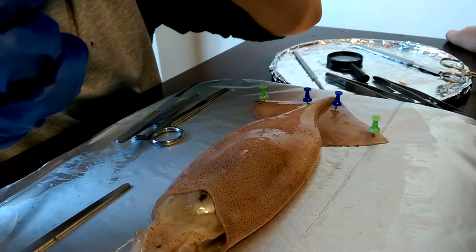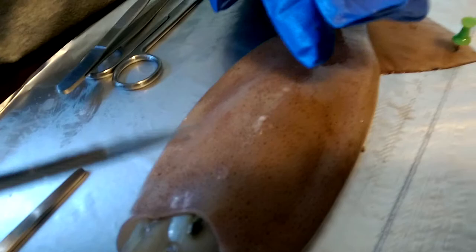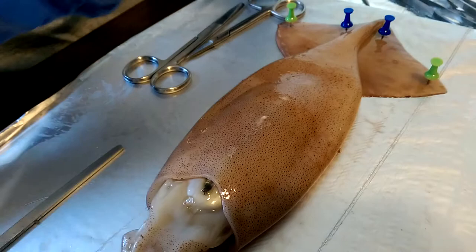Okay, this is part of the skin. As you see, it's not the perfectest one, but you can see the pigments. You also see how it's naked. Technically, the skin is the most important thing this squid ever needed in its life. Continue with the dissection.